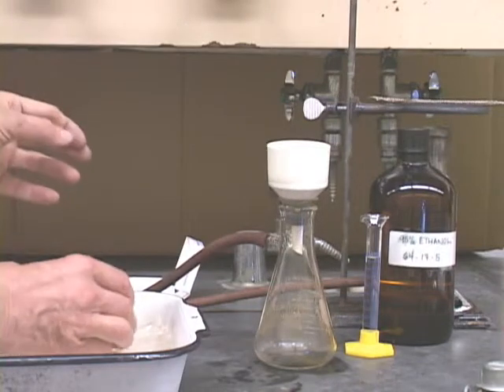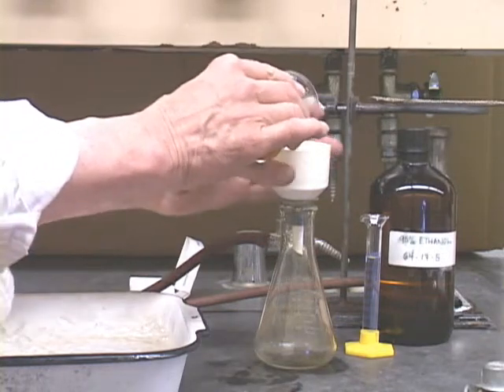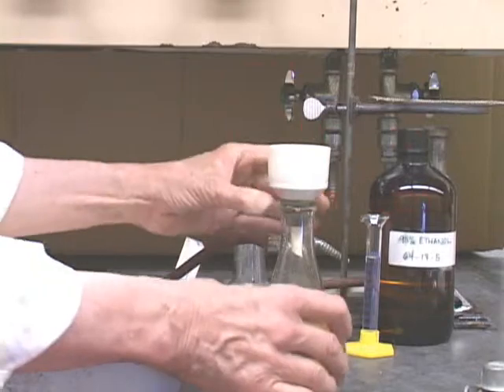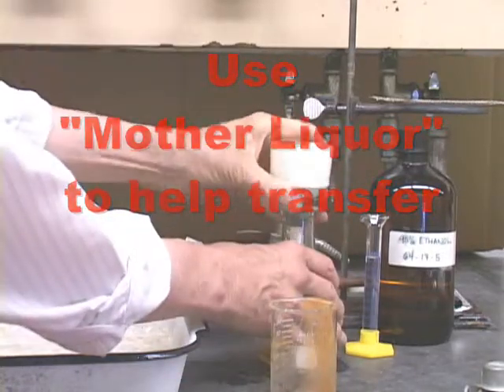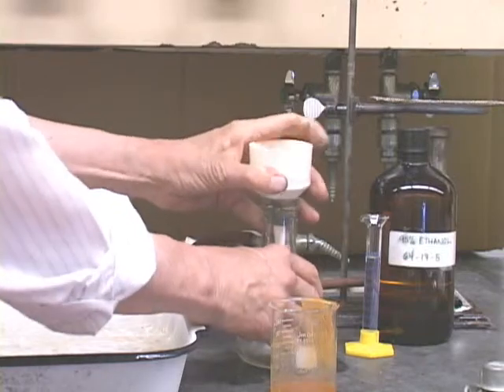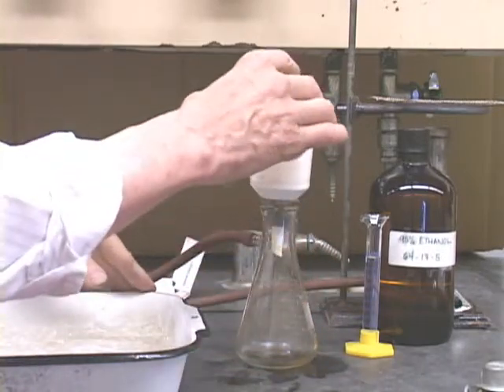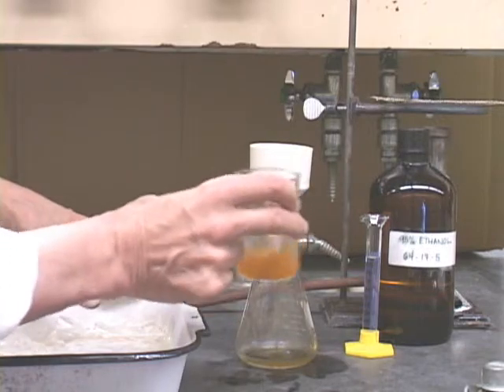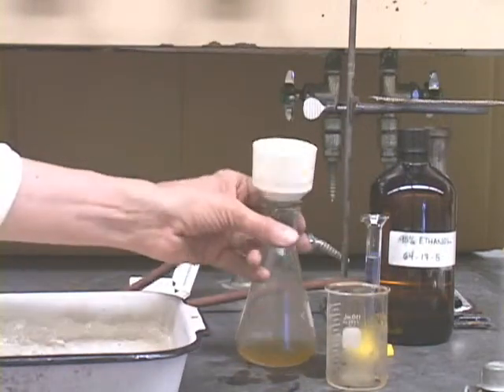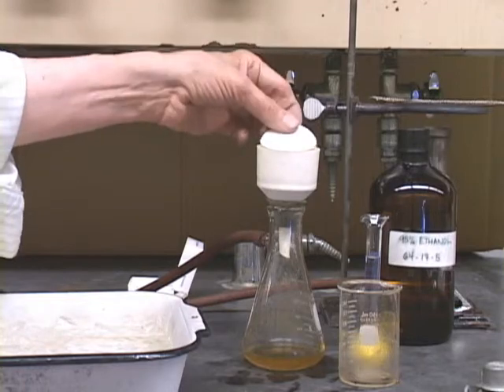Swirl the beaker with product and collect in a clean Buchner funnel with new filter paper. Again, make sure the filter paper is seated properly. Use the mother liquors to transfer essentially all the precipitate into the Buchner funnel. When all the product is in the funnel, put a filter paper on top and press out any remaining liquid.